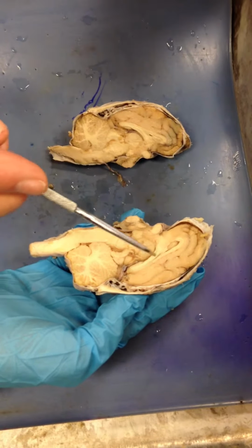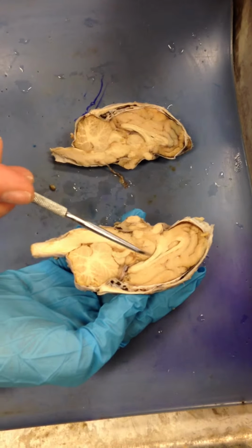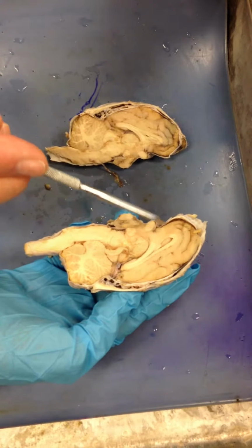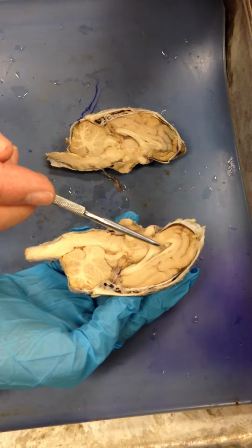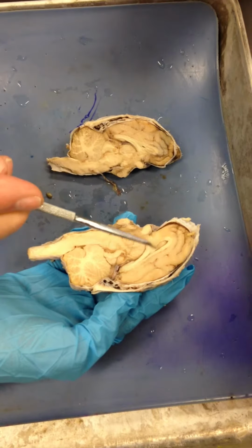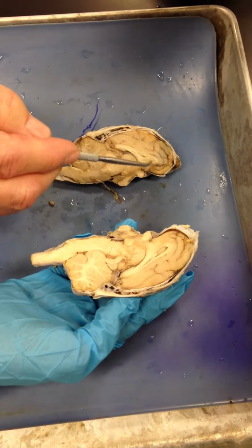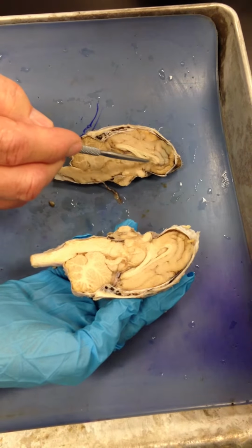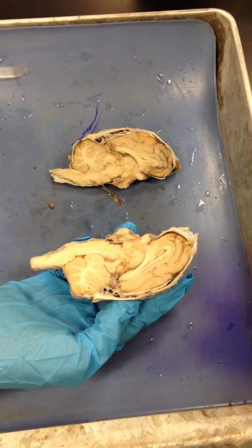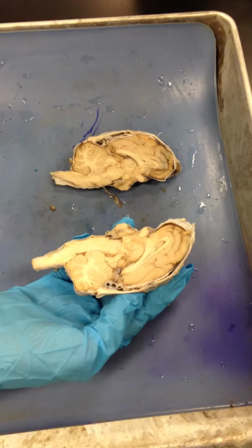These lateral ventricles are just anterior to the fornix. Oh, okay. So this is your lateral ventricles here and here. And we said the septum pellucidum is this little membrane that you can see right here. Oh, so they're pretty much the same thing. Well, it's a left and right side of the lateral.